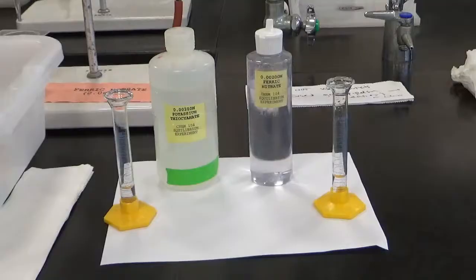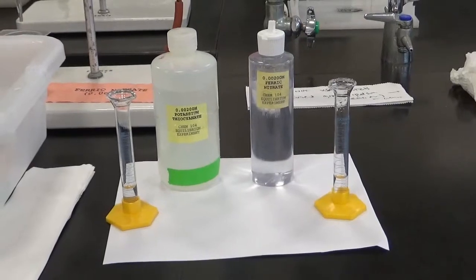So far in the course, we've really only talked about reactions that go to completion in Chem 103. It's all about reactions that go all the way. But in fact, many reactions actually reach some sort of balance point where the rate of going forward and back equalizes, and we call that point the equilibrium point. So this is part A of the equilibrium lab.